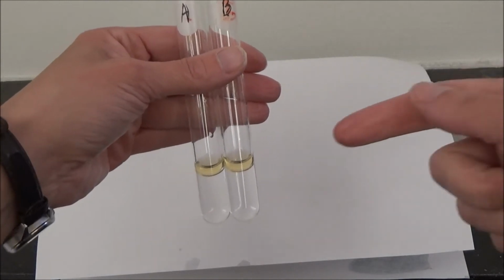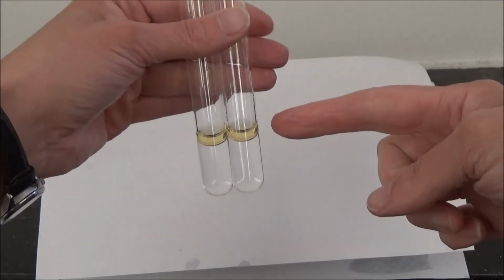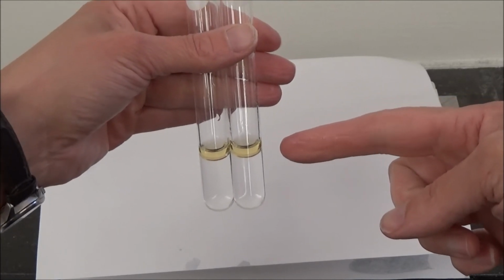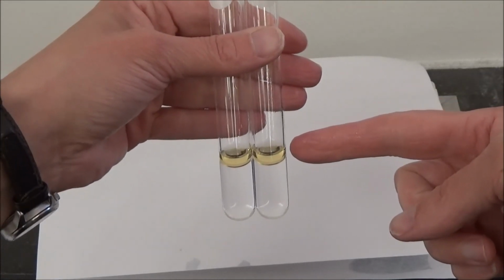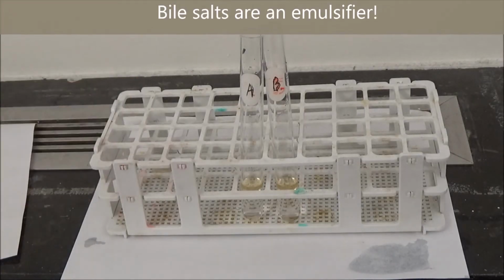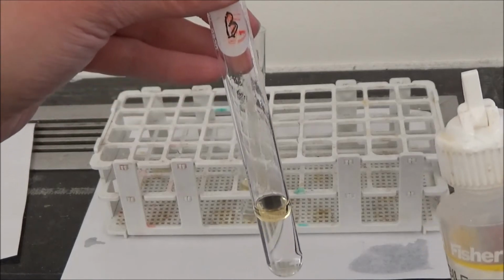I think you can see that the sesame oil is sitting on top because it's hydrophobic. So the water is on the bottom, and the sesame oil, our triglyceride, our lipid, is sitting on the top. And even if I swirl these around, we see the triglyceride stays on top. So I'm going to now add an emulsifier, bile salts, to just one of the tubes. So I'm going to leave tube A alone. I'm going to add 10 drops of bile salt to this tube.